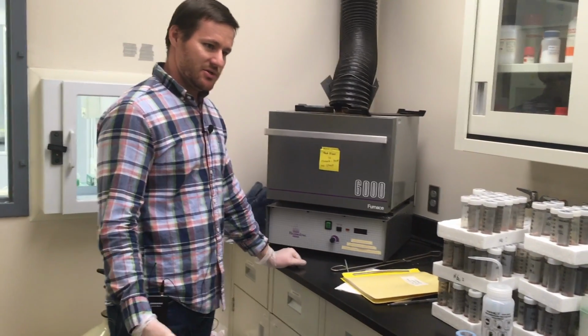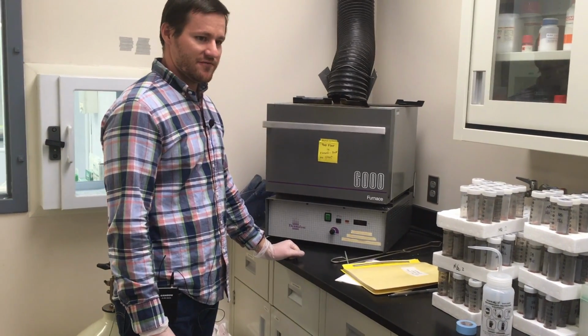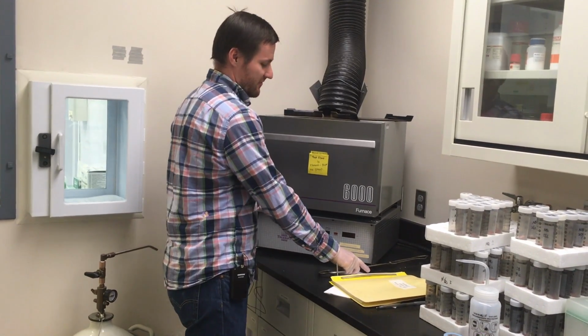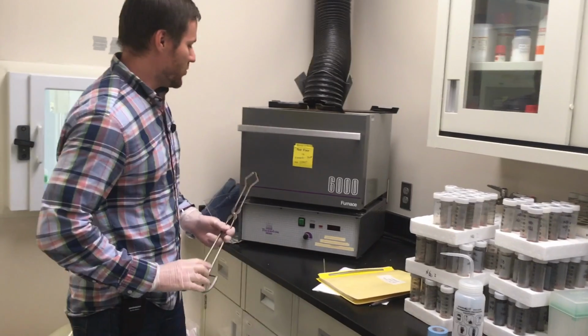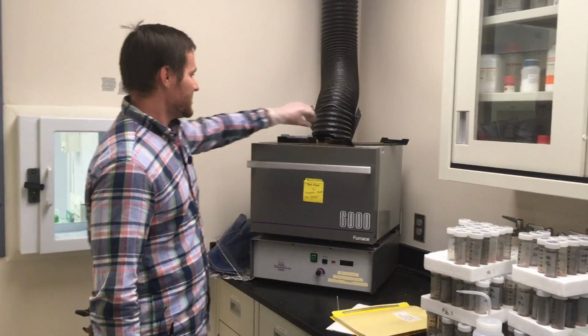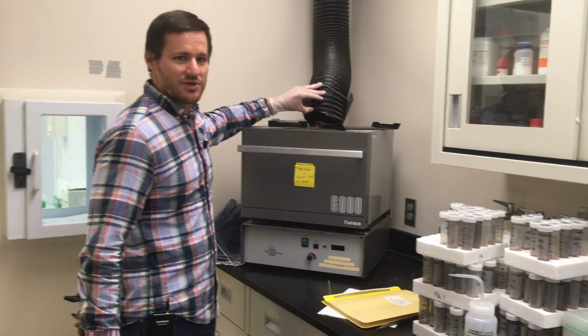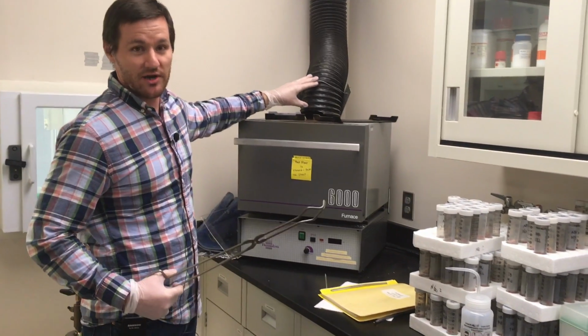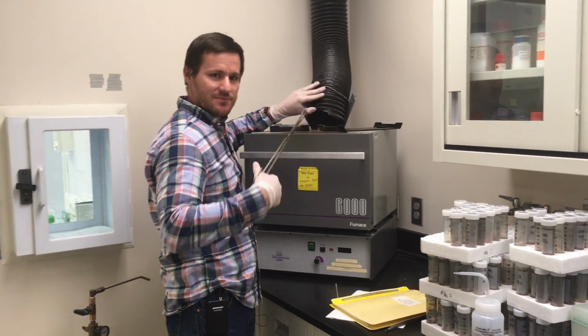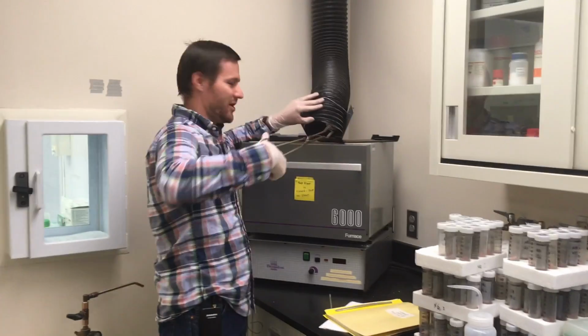For some of the samples I use, a lot of the time we ash them at 550 degrees. The first step that's important to do is to close the vent on the top of the asher. I want this asher to be at 550 degrees C. If this flap at the top, this vent, is open, it will never get to that temperature, or it'll try really hard all night to do so. And so what I'll do is, I like to use these tongs because sometimes this is hot, especially if someone ran it before I did.